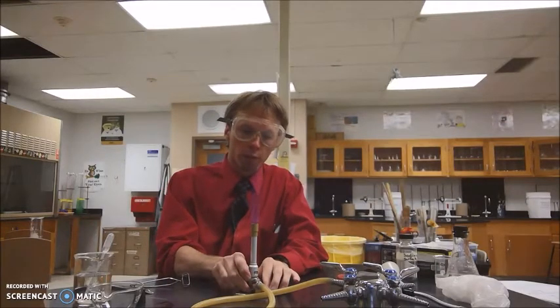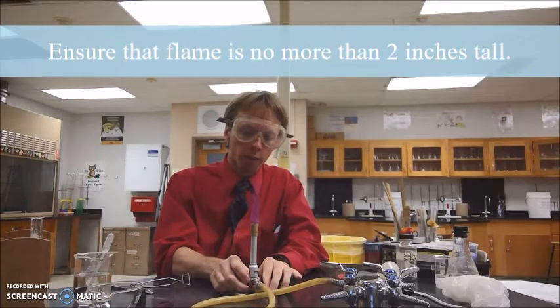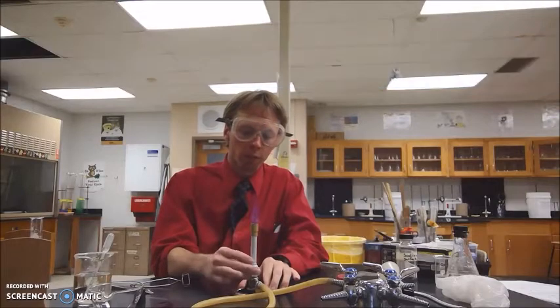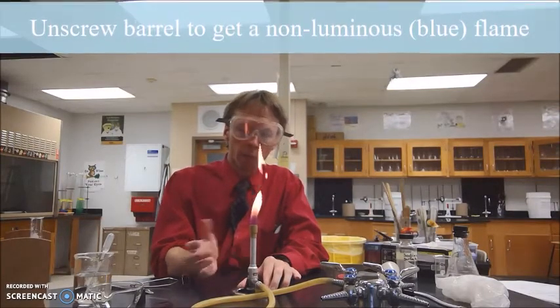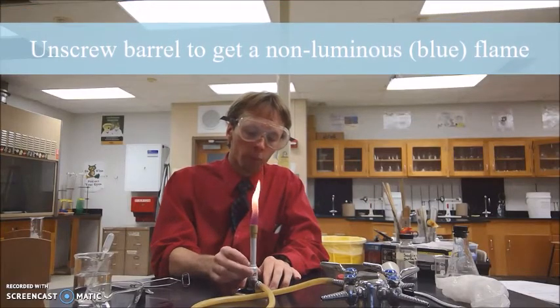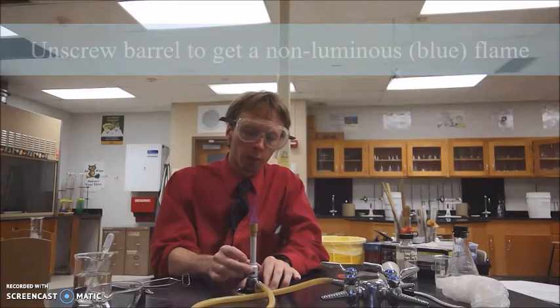You want your flame to be only a couple inches high, so if it's super tall, you're going to go ahead and turn the knob underneath it counterclockwise until you get about a 2-inch flame. Also, if you have an orange flame, that's not what we want for this lab. So you're going to go ahead and unscrew your barrel counterclockwise until you get that double blue on blue flame, with the lighter blue flame on the inside and the darker blue flame on the outside.